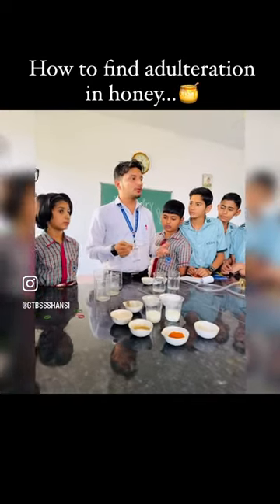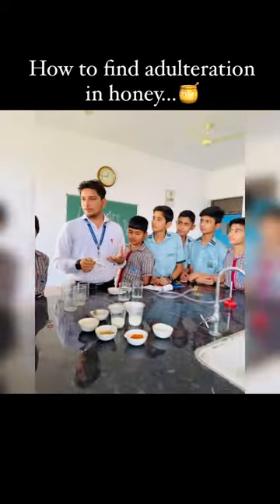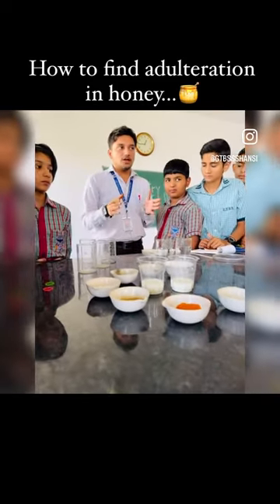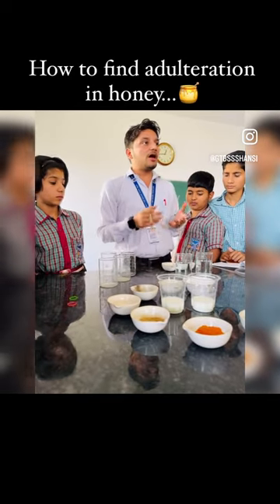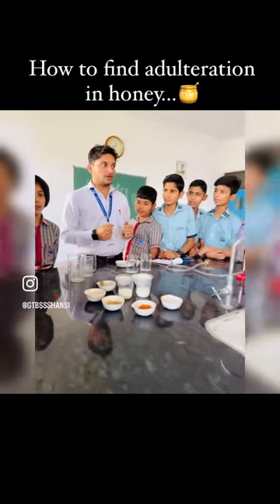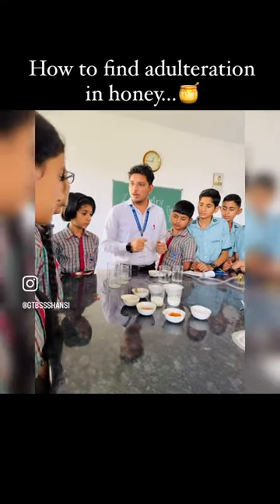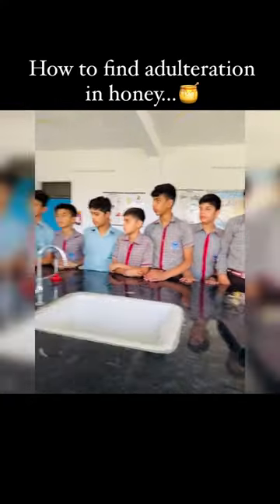Good morning, today we are going to start a new topic: adulteration. What is adulteration? To add something impure in a pure substance is called adulteration. We are going to see the process of adulteration.